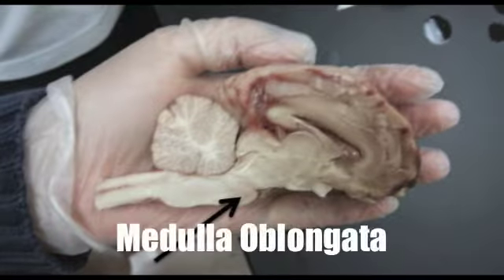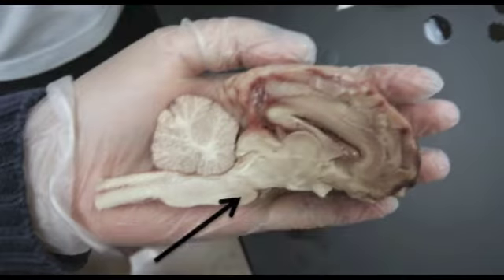The medulla oblongata controls involuntary functions. Without its regulation and control over blood pressure and breathing and even swallowing, we as humans would not be able to survive. It helps transfer neural messages to the spinal cord.